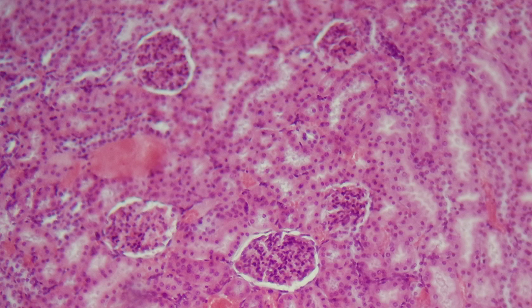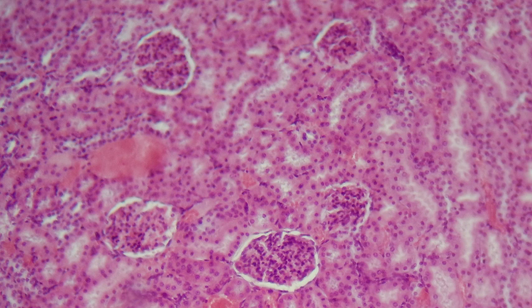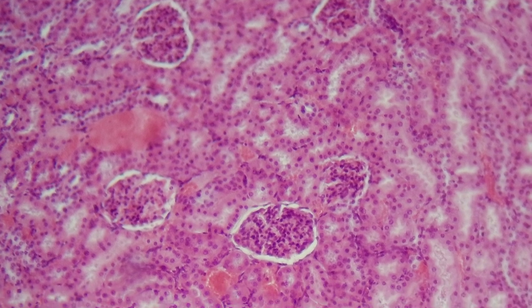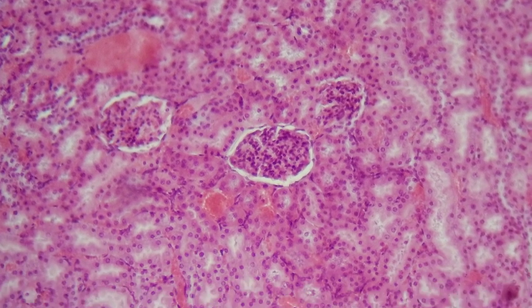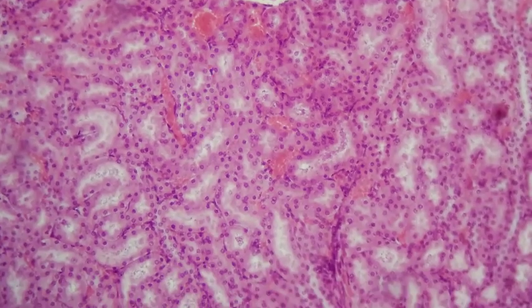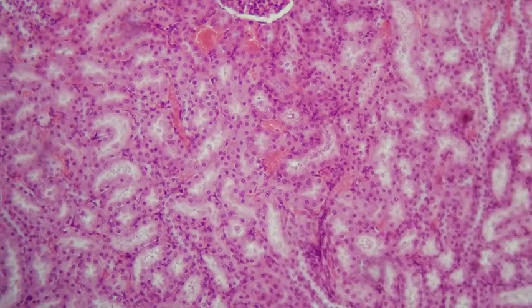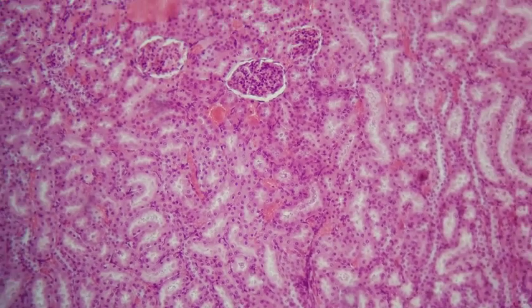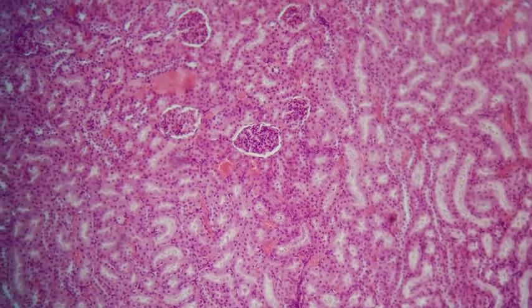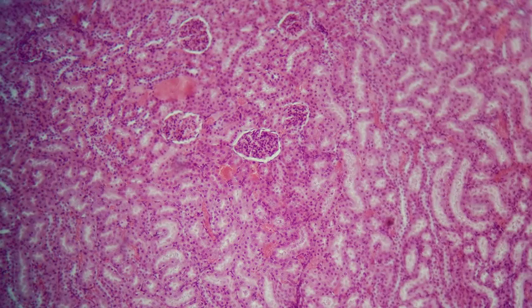In this image, you can see in the renal cortex there are renal corpuscles, but then also you can see the convoluted regions of the PCT and the DCT, which are also located in the renal cortex.